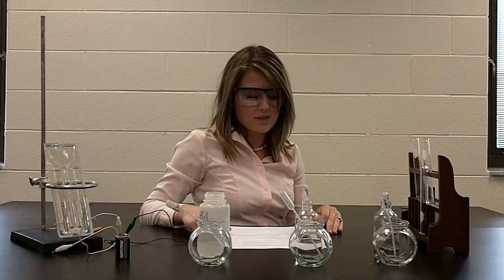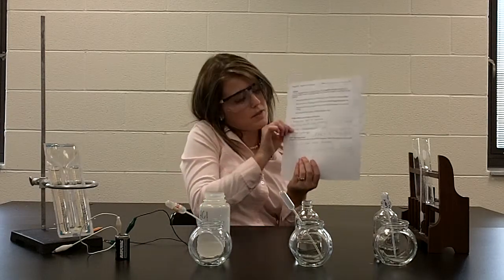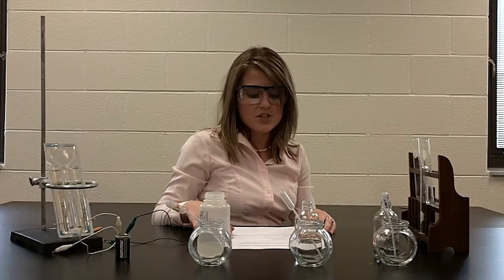The first thing we need to review is the Big 4, or the official terms for evidence of reaction, which is located in the middle of your lab report. The first official term for evidence of a reaction is bubbling. If you see bubbling in a reaction, that signifies a gas formation. Second, if you see a precipitate forming, which in this lab you'll see a color change and precipitate, it means something solid is coming from a chemical reaction.